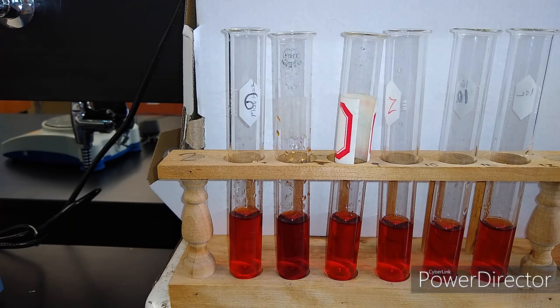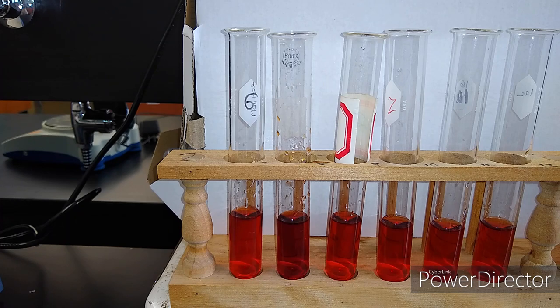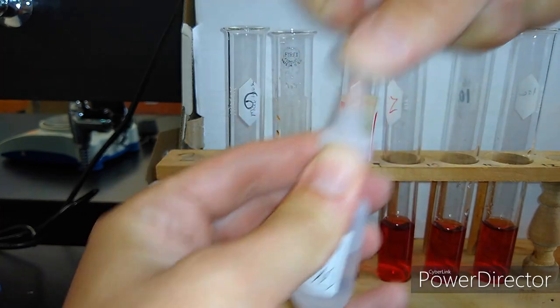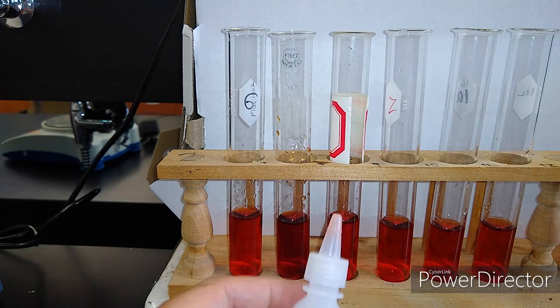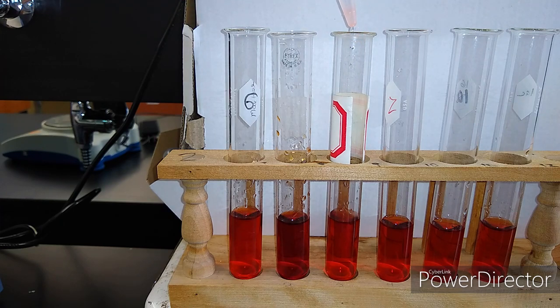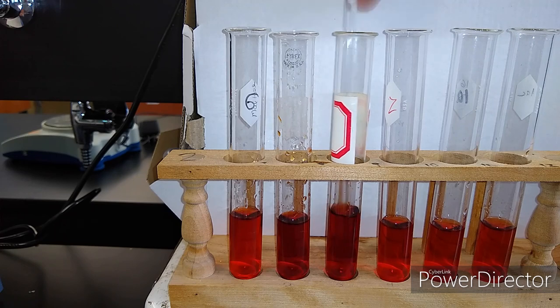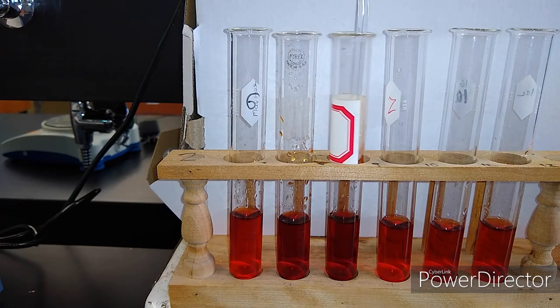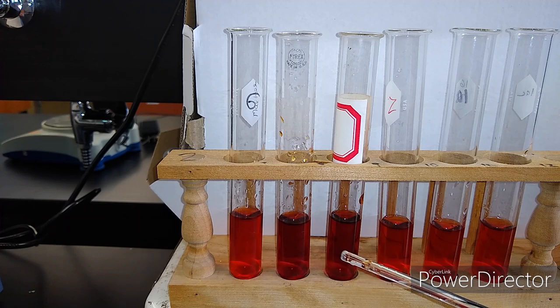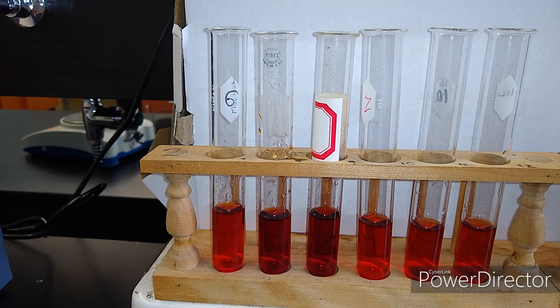Do you see a color change? I think I see something, but I'm not going to say what. The next step is to add 0.1 molar potassium thiocyanate to tube three. I'll add about thirteen drops and commence mixing. Compare tube three to the control, tube one. What does the color look like? What does that tell you about the equilibrium shift?